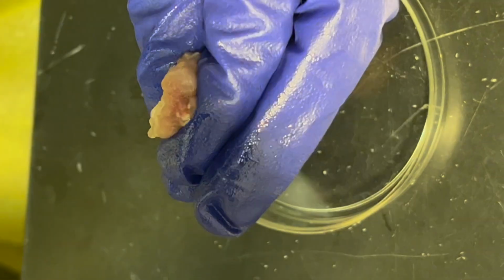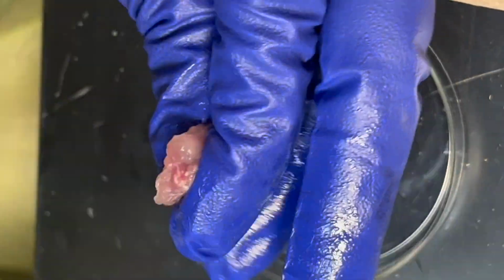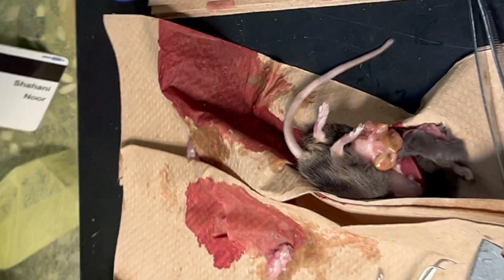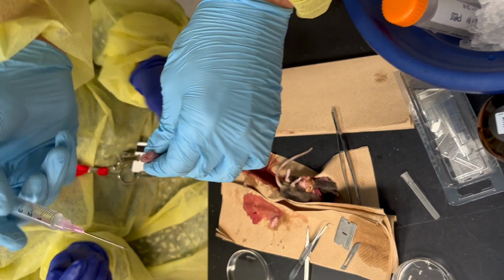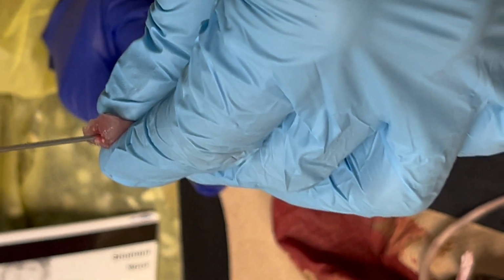Okay, so you have to go just a little bit more, because the bevel is still up. I'm just terrified of hitting your finger. I know. You want to feel it with your own hand? Just feel it, don't put it in your finger. It's kind of like you almost drill into it a little bit. You see it? Yep.